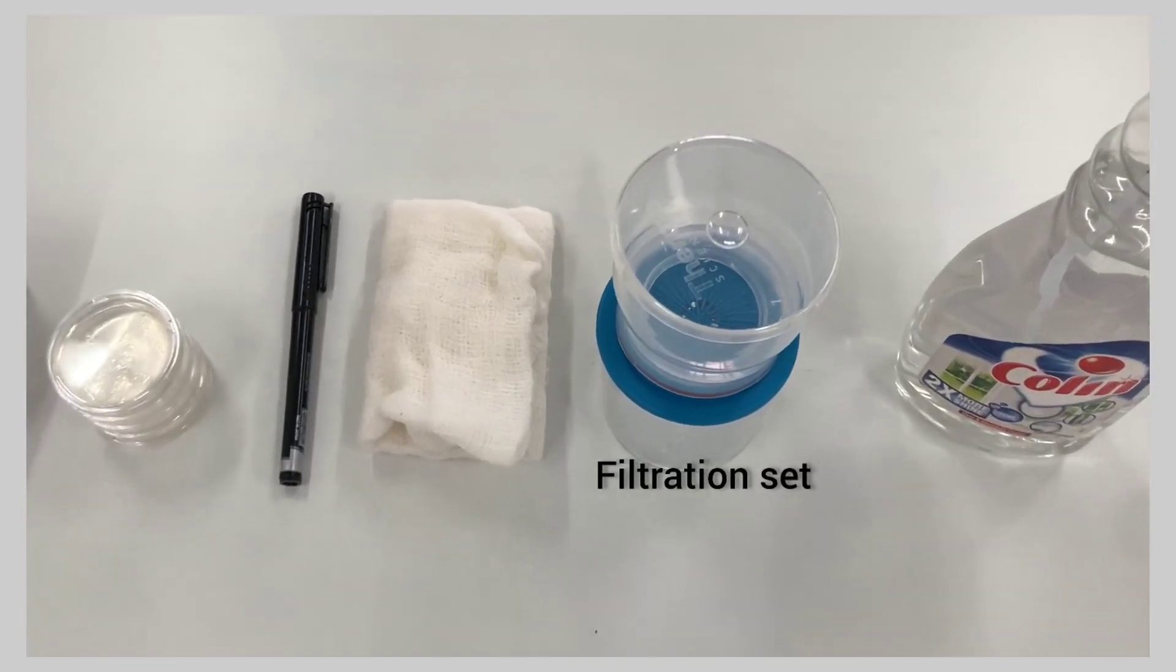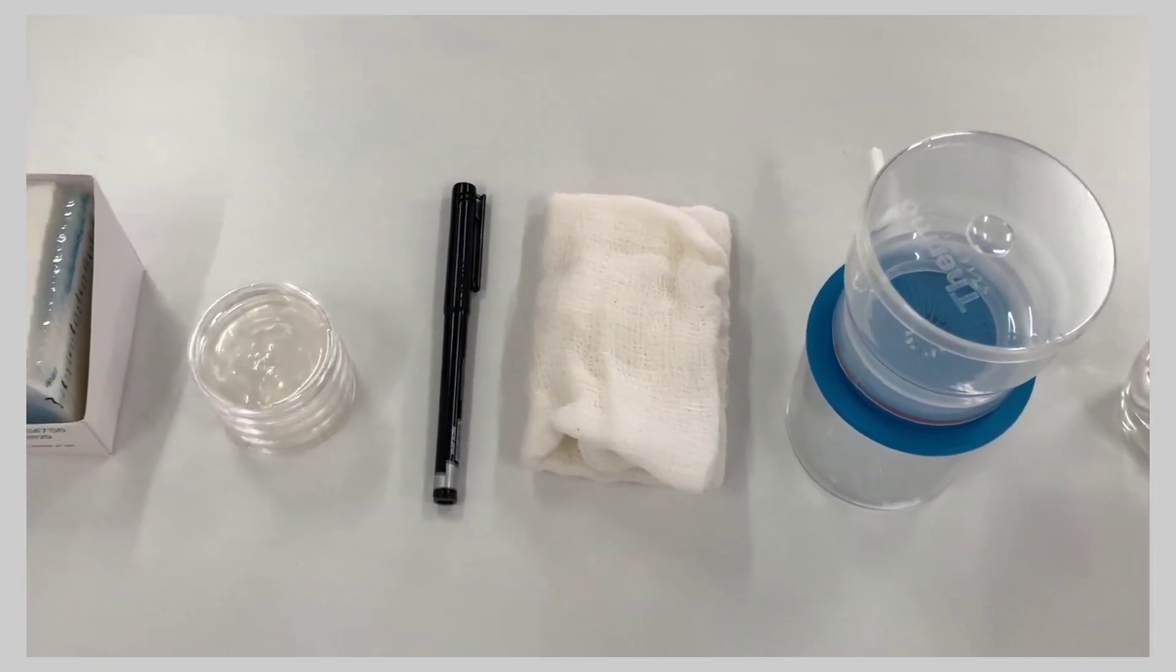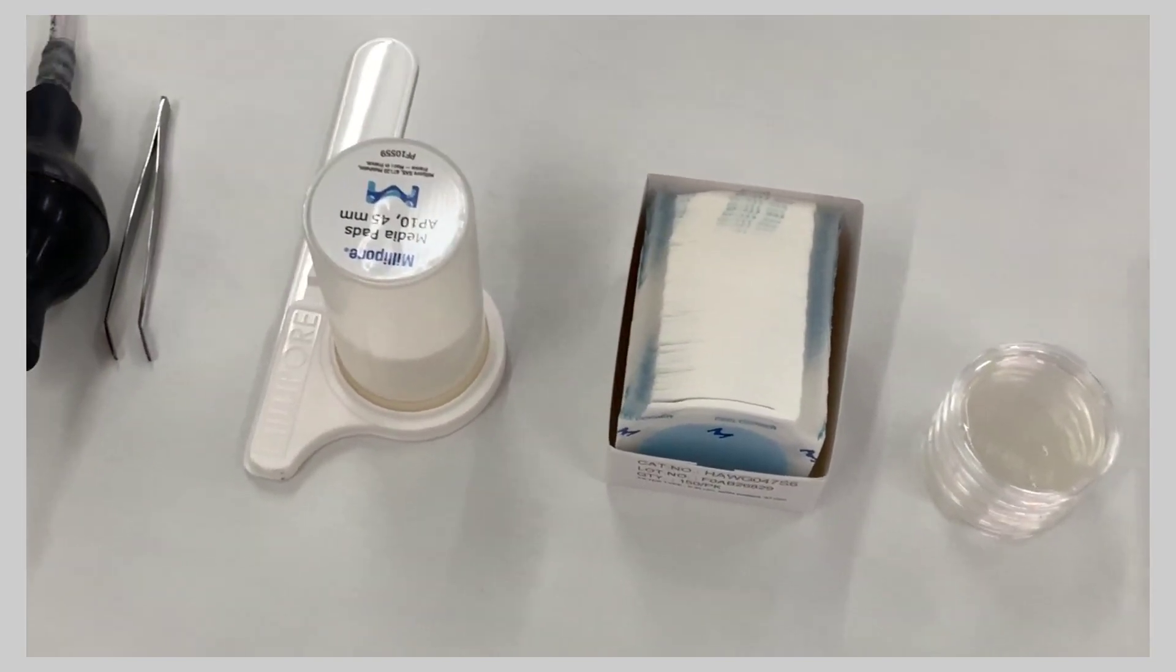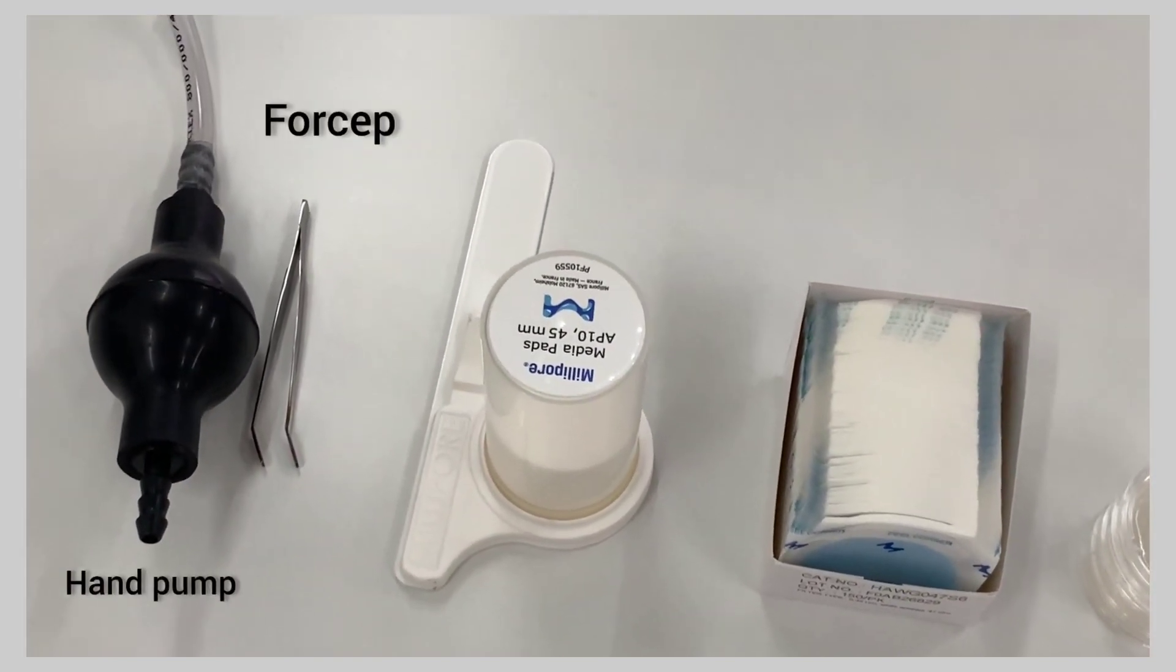70% alcohol, filtration set, gauze piece, marker, prepared media, membrane filter, membrane pad, forcep and hand pump.